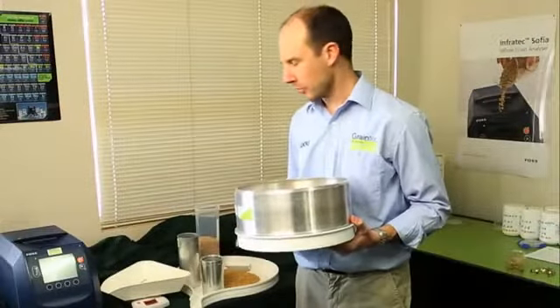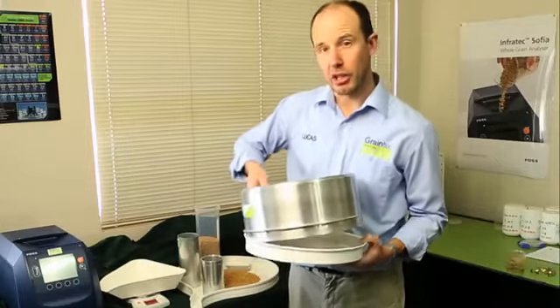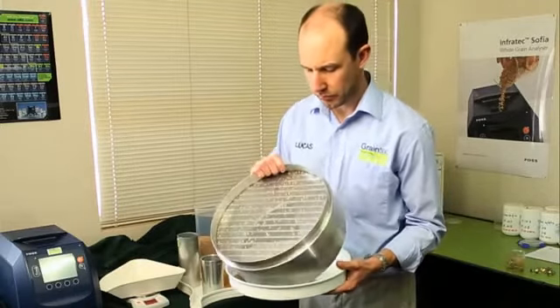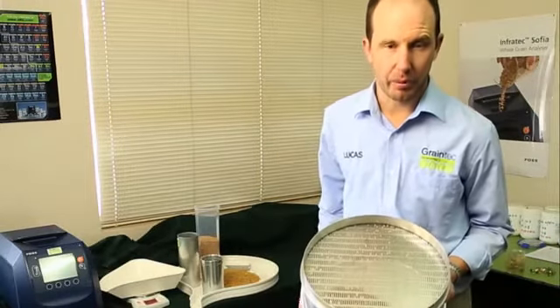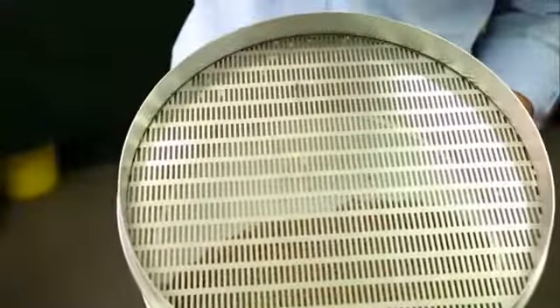When we've completed our measurement, we can pour the screenings back in with the original lot, and then we need to clean our sieve. We always clean the sieve from the back side so that we don't make these slots any larger. Just use a scraper to push those grains back through from the direction they came.